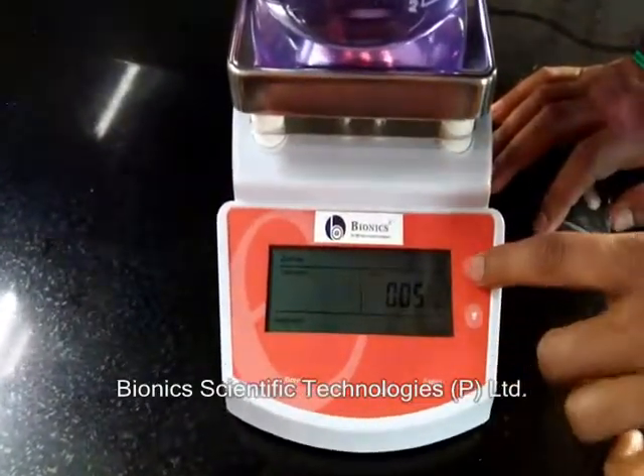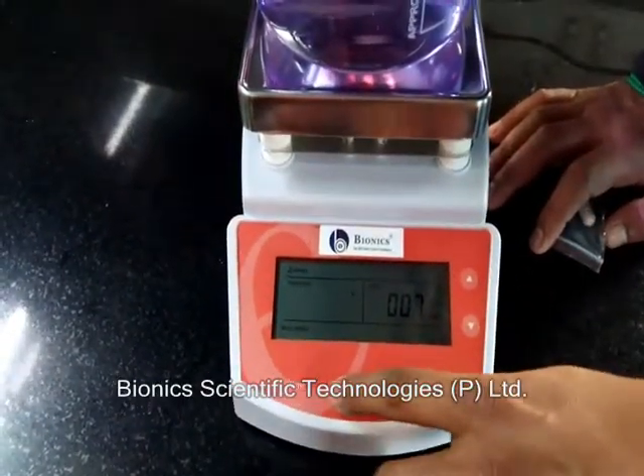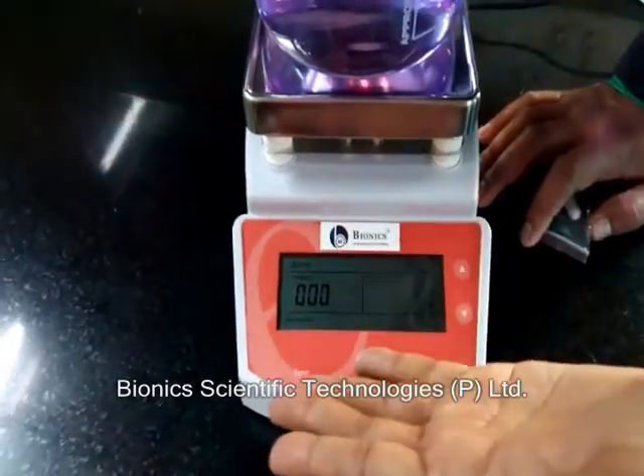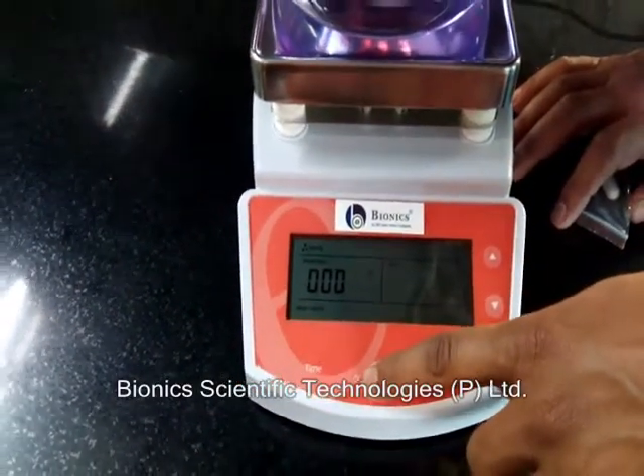You can set it for 5 minutes or up to any time you want — we choose 7. If you want to change the temperature to the desired temperature, we can increase the temperature by pushing the degree centigrade button.